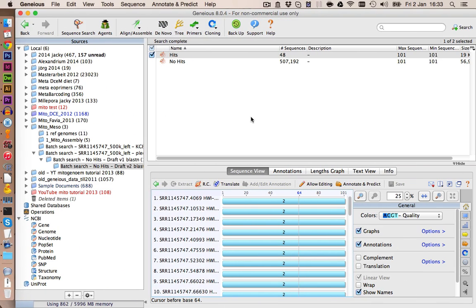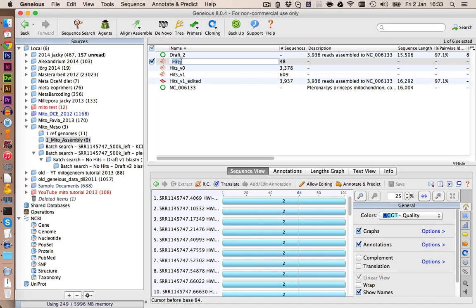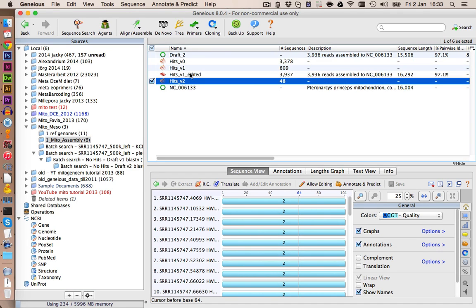Here are our hits, and I have already annotated them. What worries me a bit is that we only found 48 sequences, but let's assemble them to the draft assembly and see where they are clustering. We move this one again to our Mito assembly folder and rename this to hits version 2.